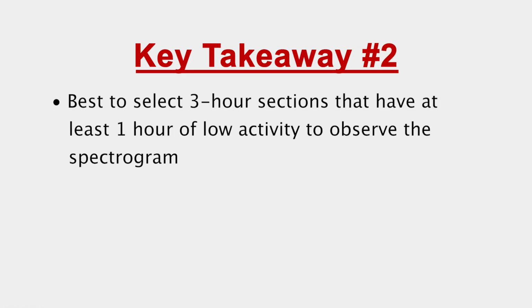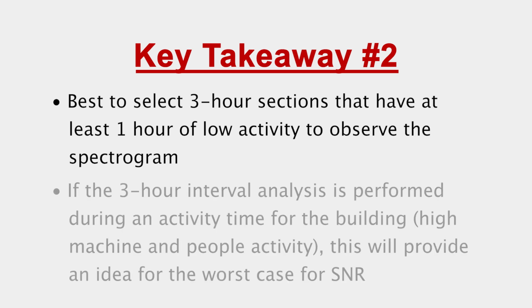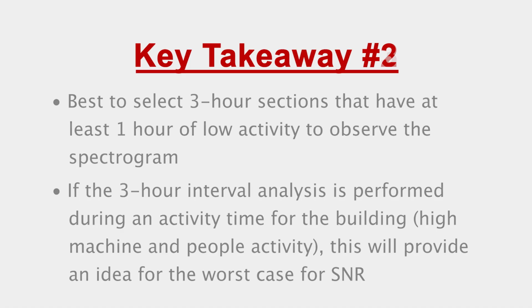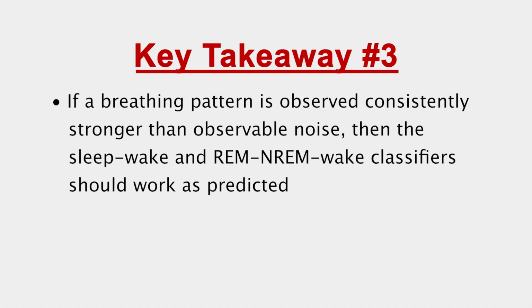It is best to select 3-hour sections that have at least an hour of low activity and observe the spectrogram. If the 3-hour interval analysis is performed during an activity time for the building, this will provide an idea of signal quality during the worst case for SNR. If a breathing pattern is observed consistently stronger than observable noise, then the sleep-wake and REM-NREM wake classifiers should work as predicted.